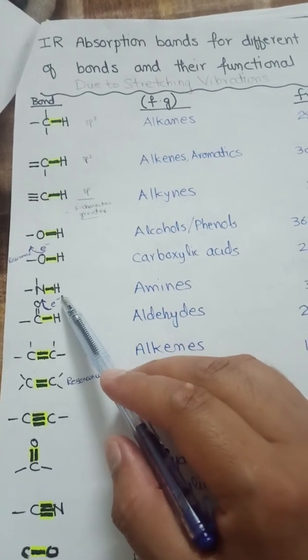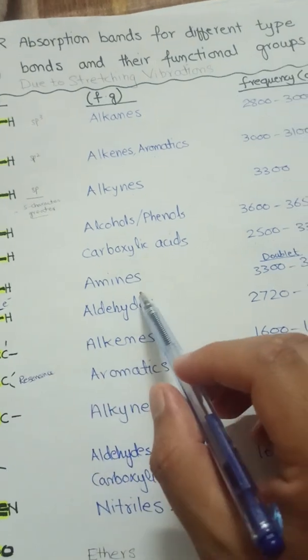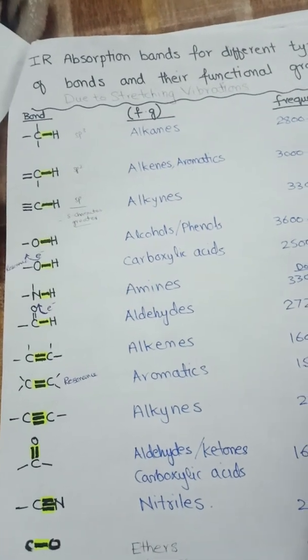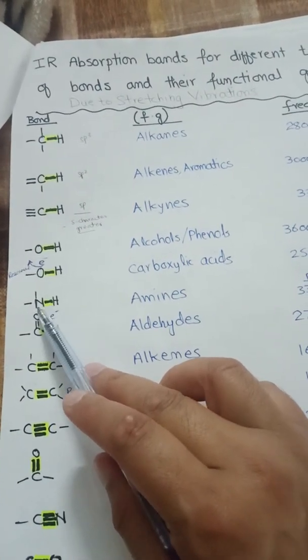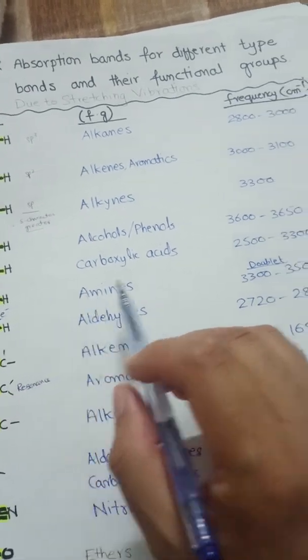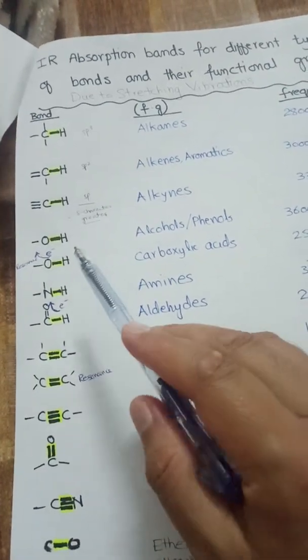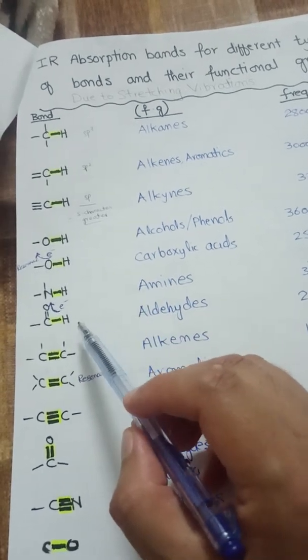For N-H bond stretching in amines, the frequency is 3300 to 3500 per centimeter and a doublet will be present. Similarly, when the amine is present with a carbonyl group as in amides, the stretching vibration frequency is lowered, analogous to what happens with O-H stretching in alcohols versus carboxylic acids.